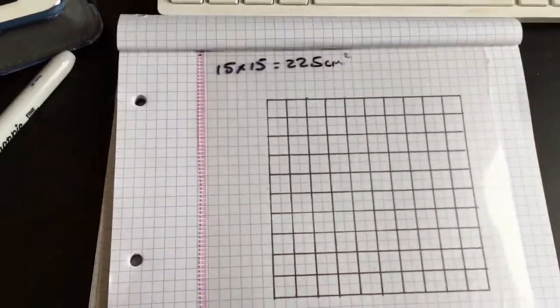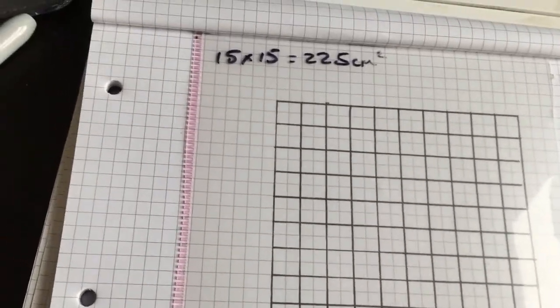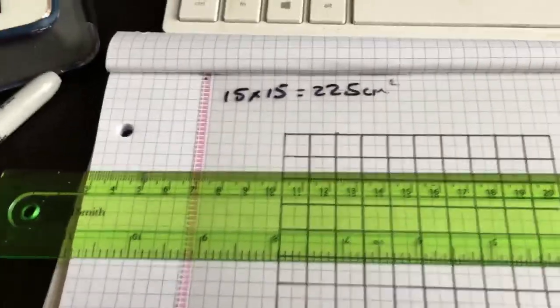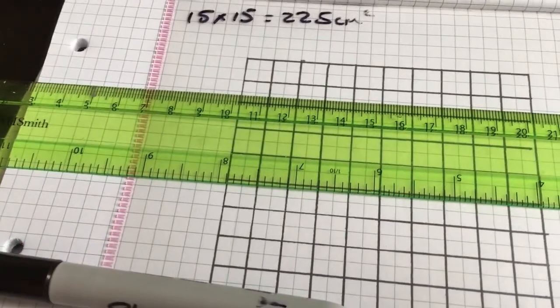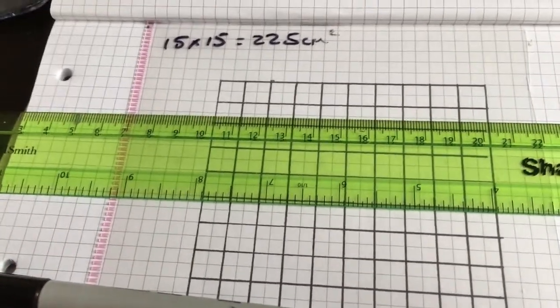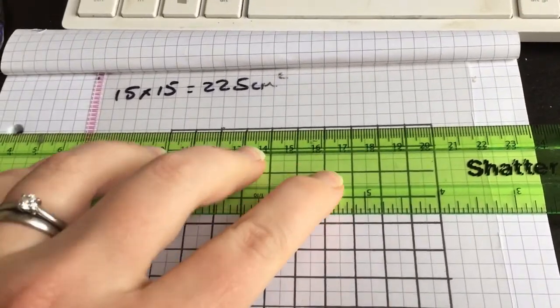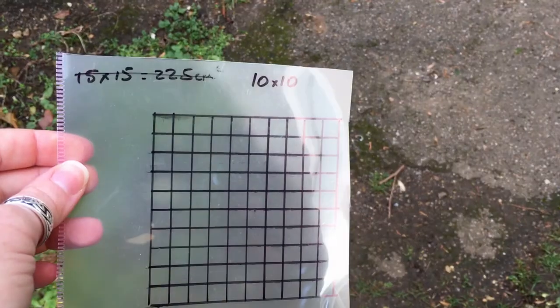Once you have drawn your grid, your template, what you can then do is, with a ruler and a permanent marker like a Sharpie, try and get the fine points, because they will be more accurate. Then you're going to transfer the grid onto your plastic. So I am going to do that, and I'll get back to you to show you how to use it.